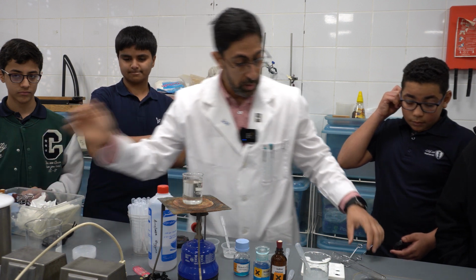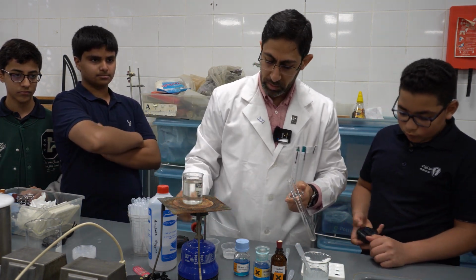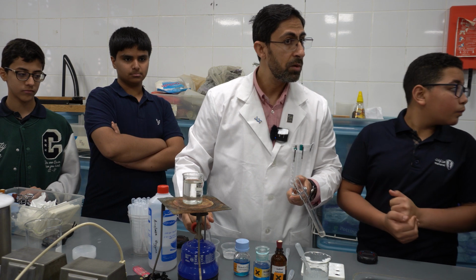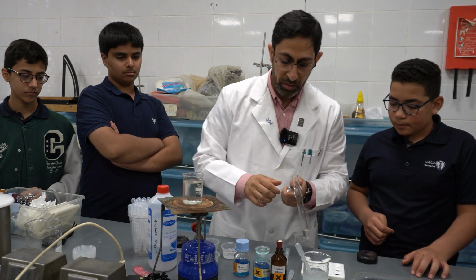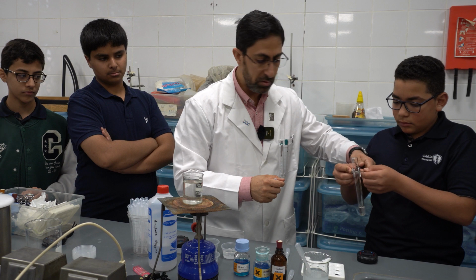Sorry. Here I will add 5 milliliters of the sugar, or the starch. But of course, after the enzyme breaks it down, then I will add... You can catch it. Yes, thank you.